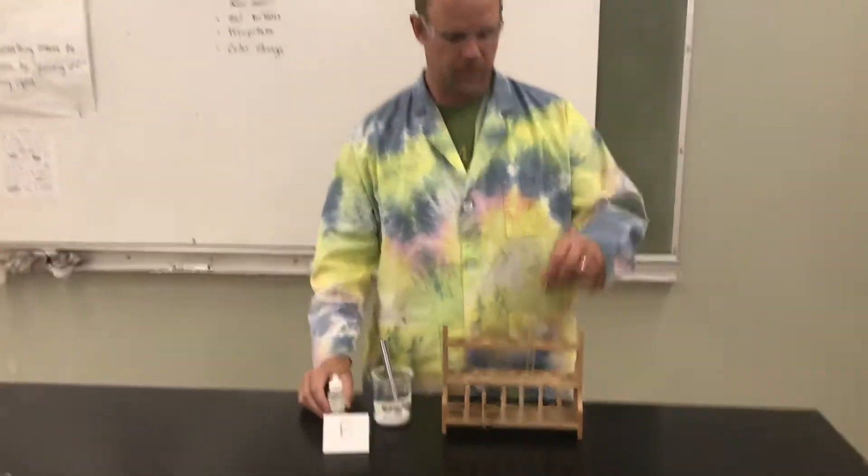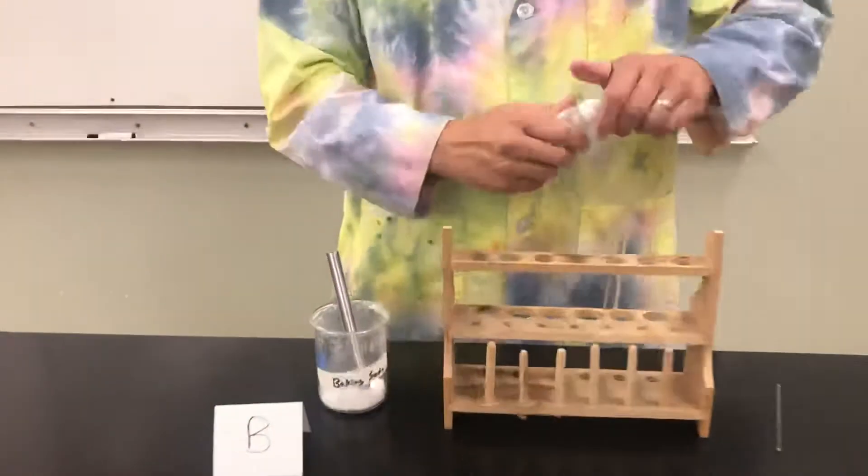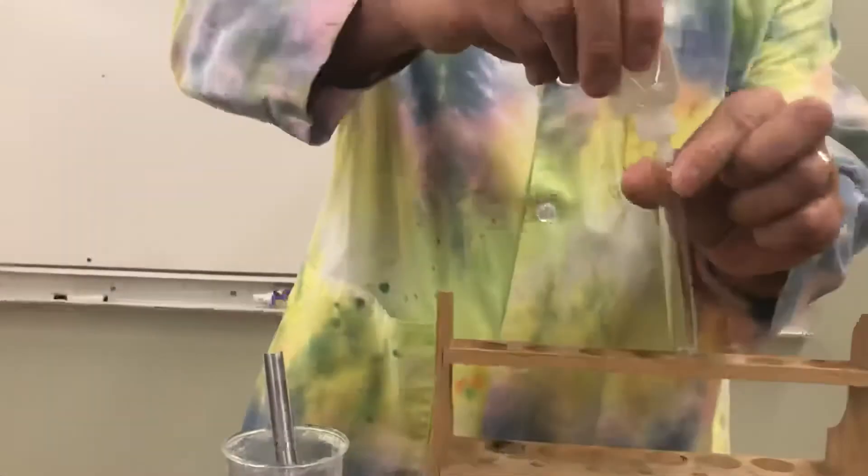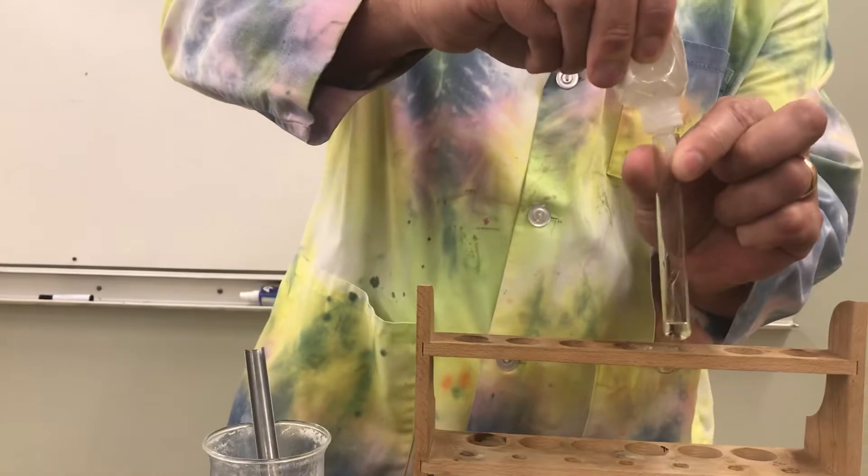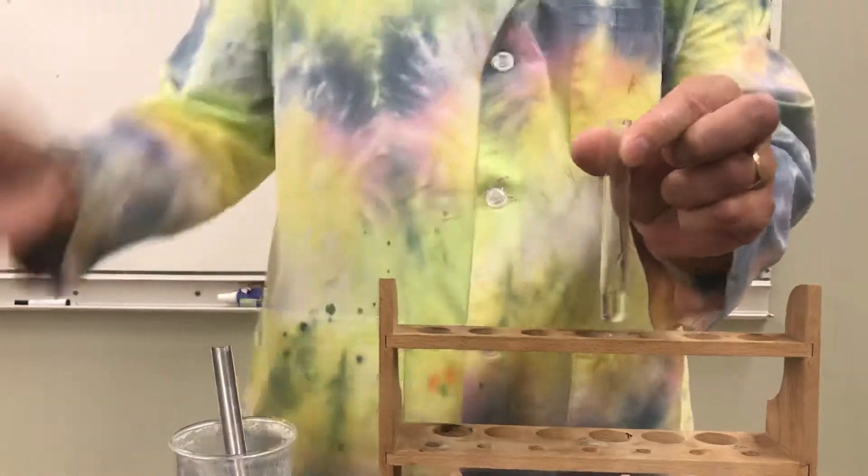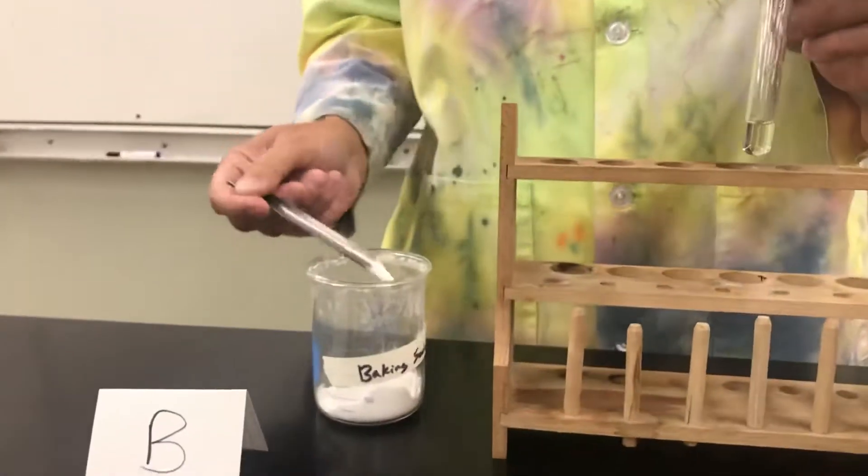Okay, so we're going to begin by adding some distilled water to this test tube. And now I'm going to add a small scoop of baking soda.